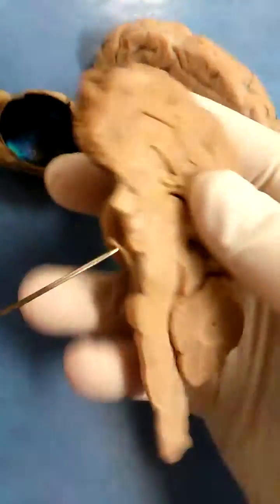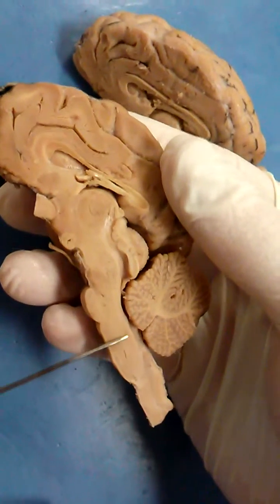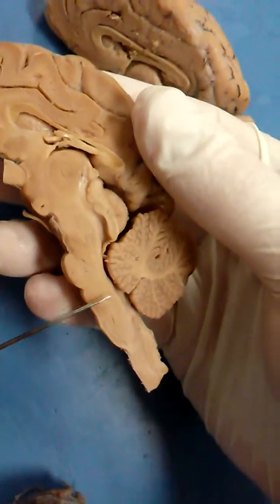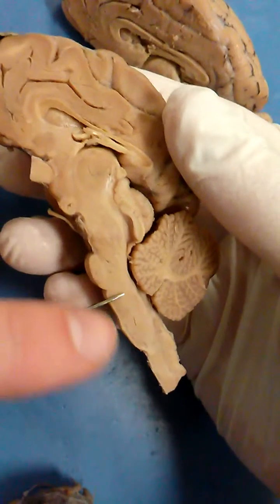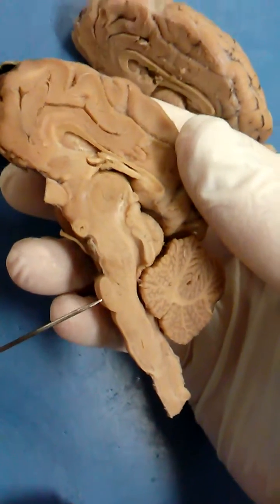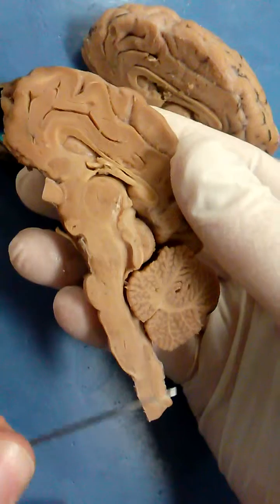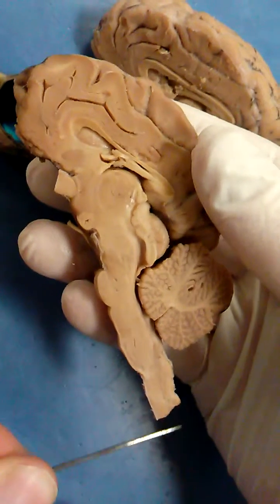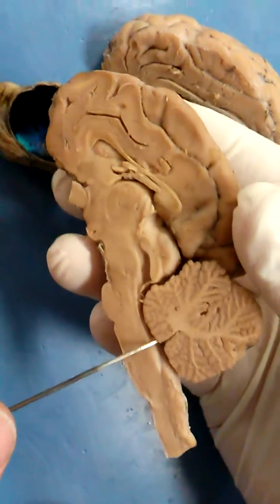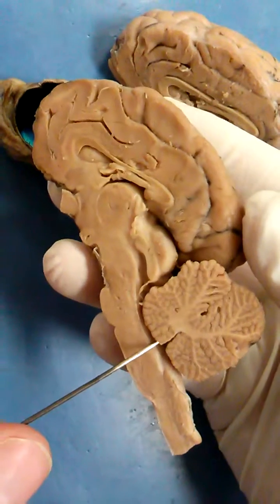Going back to this one. From here to about here is the pons — it has a little puddle-y, pokey appearance. And then from here to here is the medulla oblongata, because it's oblong. Right here we have the fourth ventricle.